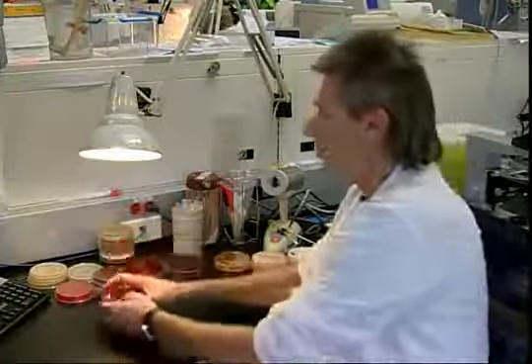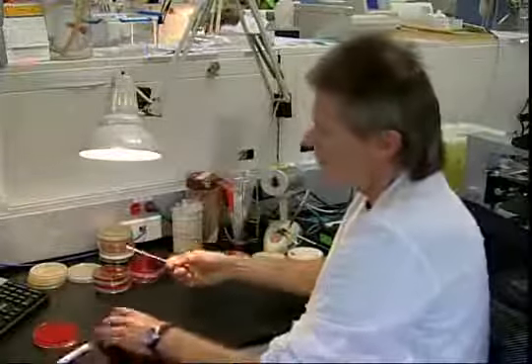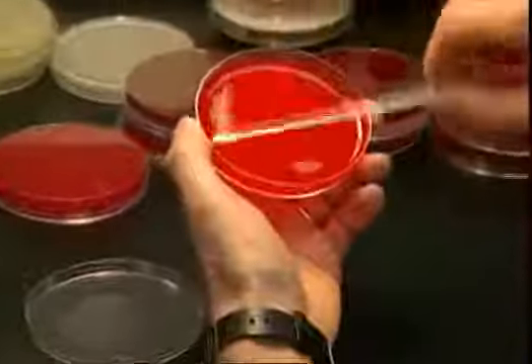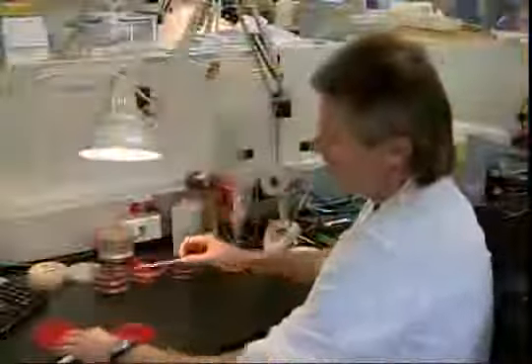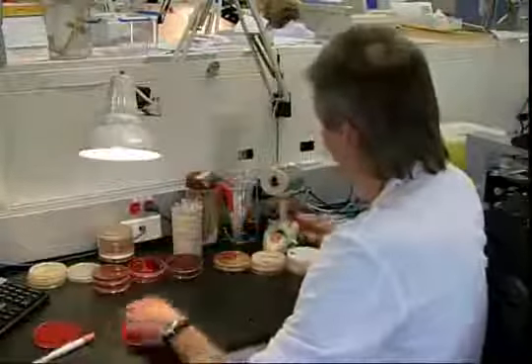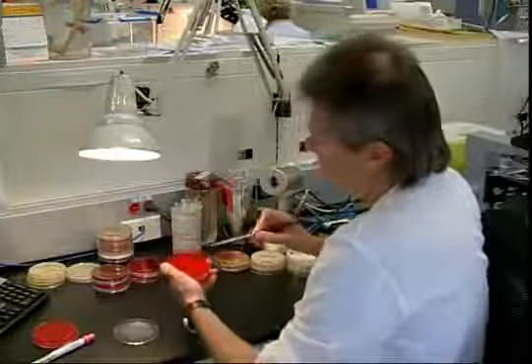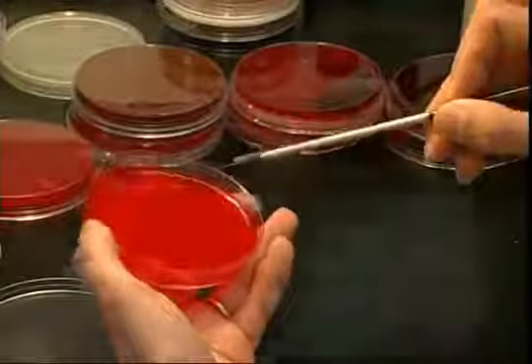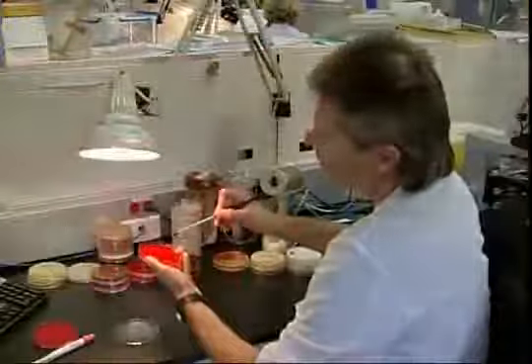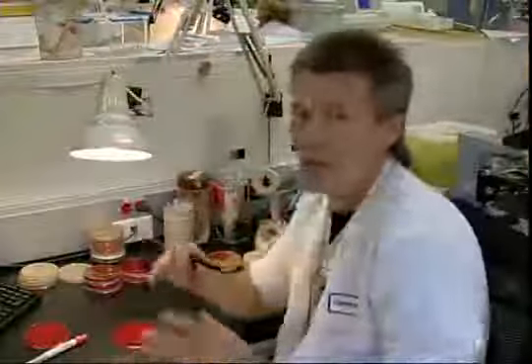So normally when we get a swab that you send down from the floors, we would take that swab, inoculate the agar, rolling the swab to get all the bacteria off it, and then we would take a wire, sterilize it, and we would spread all that inoculum over the whole plate. Now you may wonder why we do this streaking technique. It's to spread the bacteria out, to find the specific pathogens.